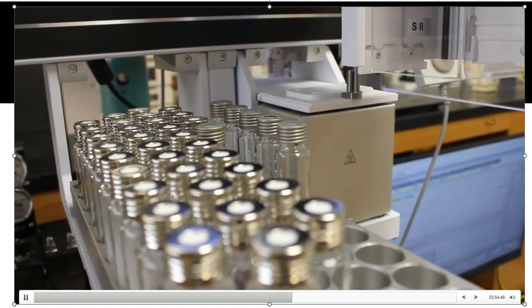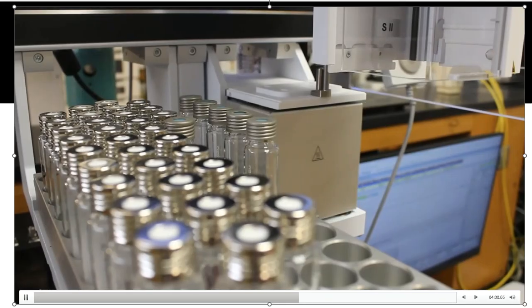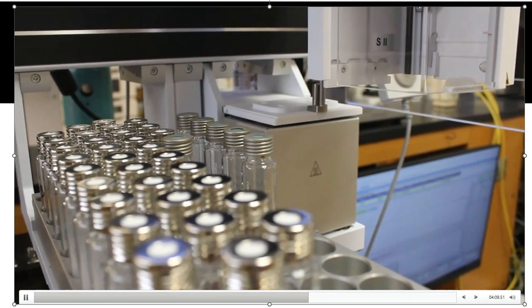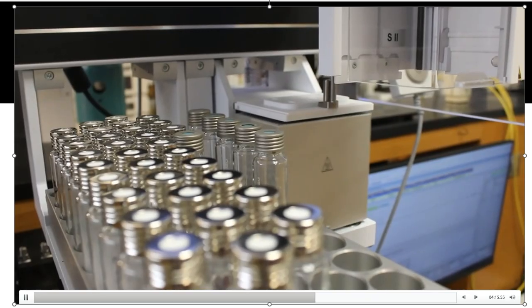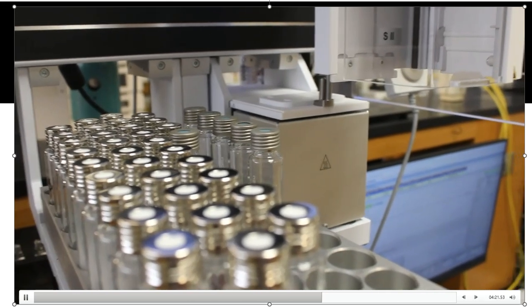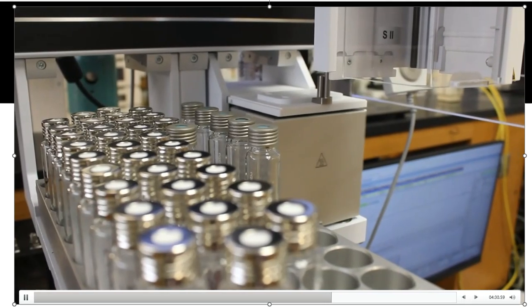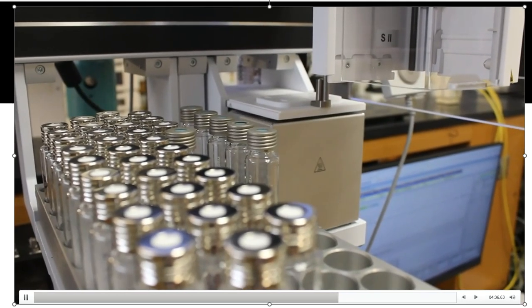So what will happen is that right now one is in there shaking and jiggling, and then it's going to stay in there for a little bit. And then it's going to start piggybacking onto those standards and samples. So in a few minutes, this auto sampler is going to come over and grab another container, and it will put the other container beside the first one, and it will start to jiggle them at the same time. And then number 3, number 4, number 5, whatever it takes, as long as it timed itself the proper way, it's going to be able to do that. So it speeds our process up much faster. It's a very dynamic type of injection that begins to go on. So that's kind of why there was a pause.